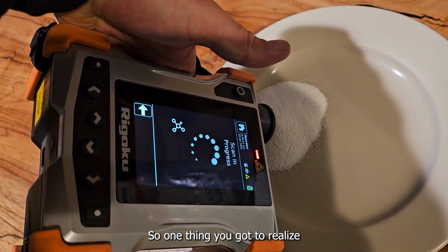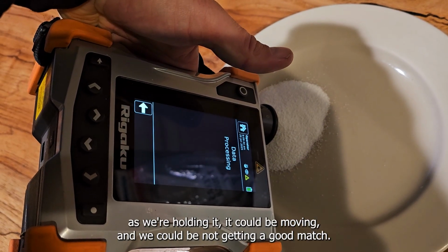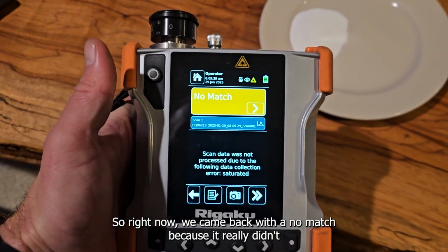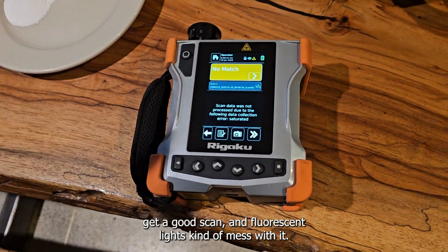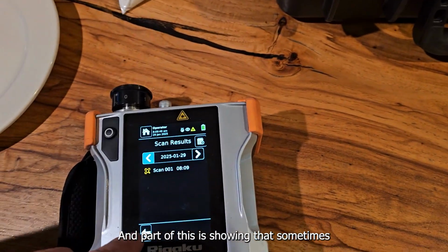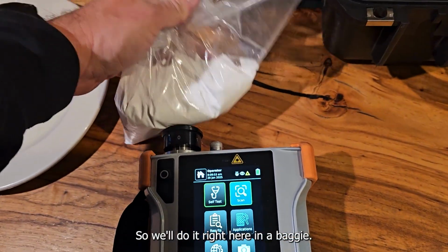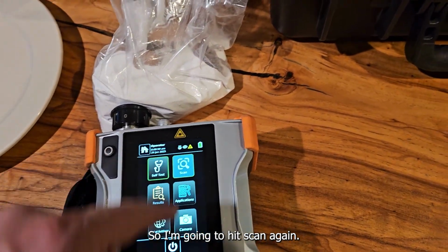One thing you've got to realize is that since this thing is a laser trying to point at one thing, as we're holding it, it could be moving and we could be not getting a good match. So right now we came back with a no match because it really didn't get a good scan, and fluorescent lights kind of mess with it. So we'll try to run some more scans and see if we can get a good match. Part of this is showing that sometimes just changing the way you scan it will get you a better scan. So we'll do it right here in the baggie, get that set up to where it's nice and close. So I'm going to hit scan again.